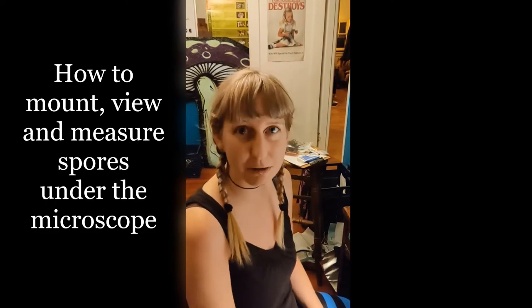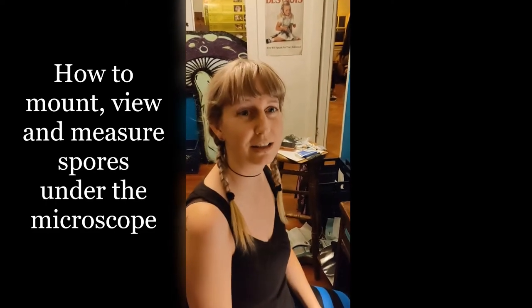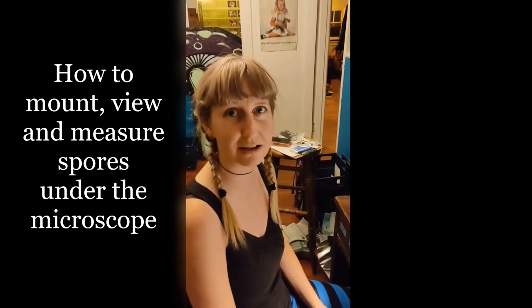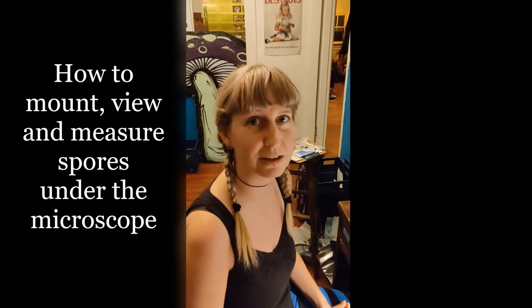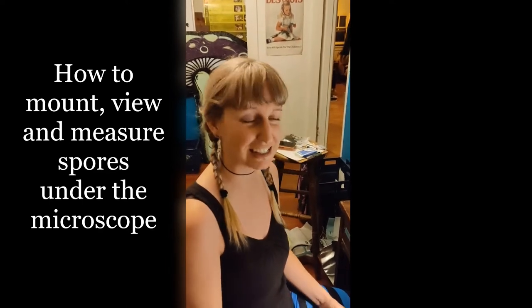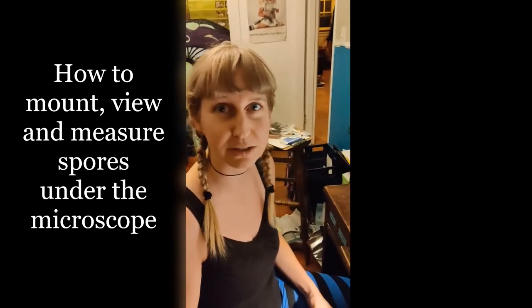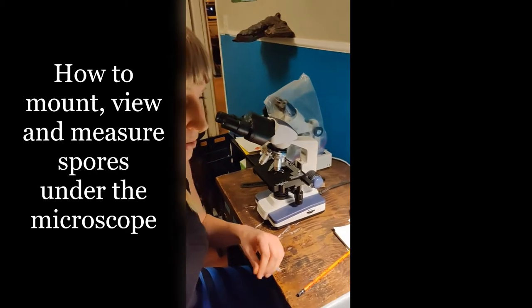Hi, so we're going to do some microscopy today. I just did a fungal microscopy class online, but that's kind of just me talking at you and it's definitely easier if you can see the process of what we're actually doing. So I'm going to show you what I'm doing.